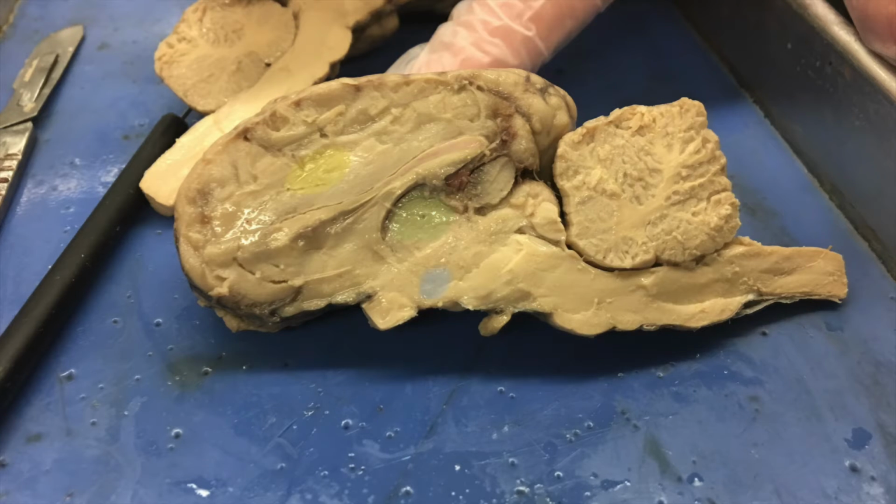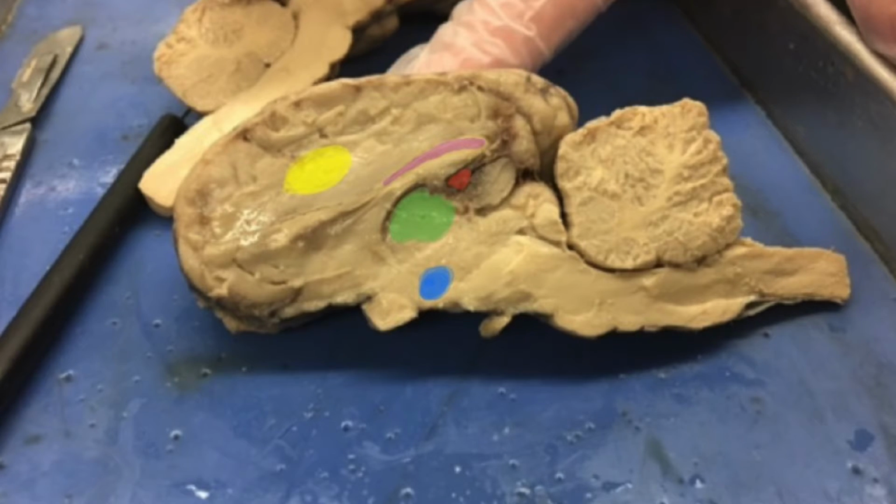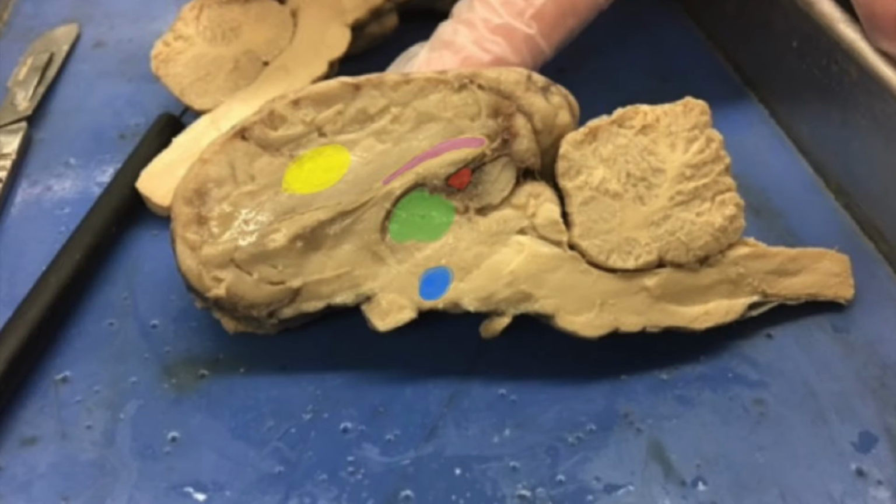Closest to the front of the brain and highlighted in yellow is the amygdala. The amygdala are structures of gray matter in each cerebral hemisphere that are heavily involved with experiencing emotions, particularly the emotions of fear. The fight or flight instinct is controlled by the amygdala. Logically, it makes sense for it to be in the front of the brain, near the lobes that are in charge of how or what you feel.